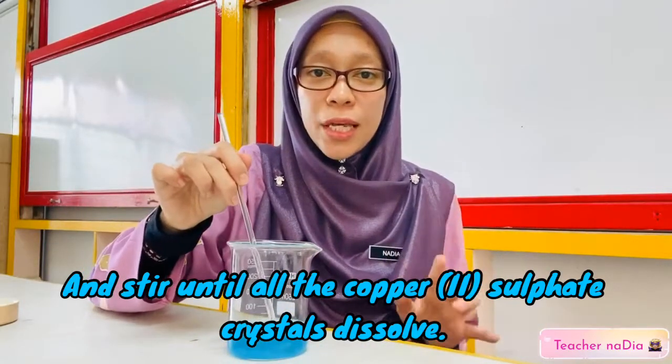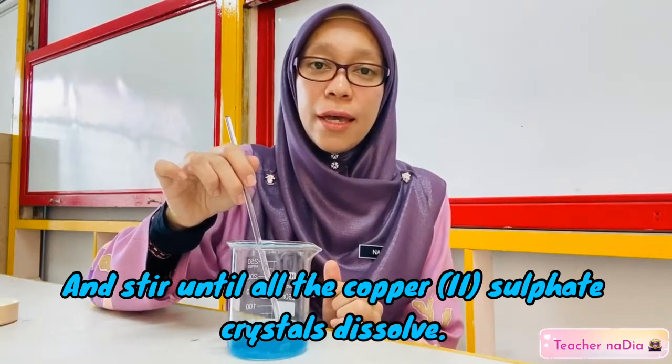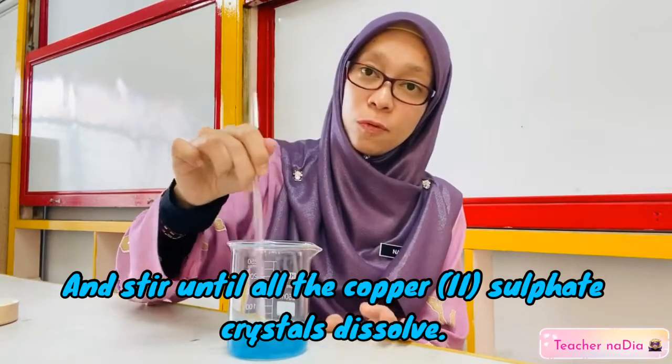Now we add 2 spatulas of copper sulfate crystal into beaker P, and we stir it until it dissolves.